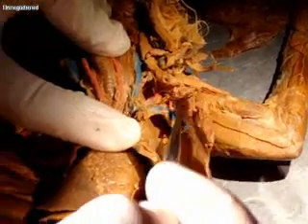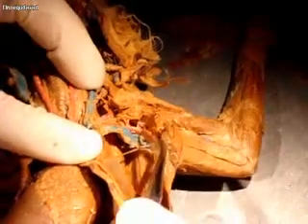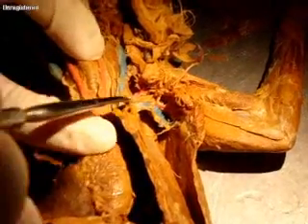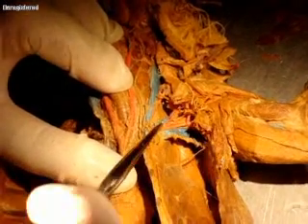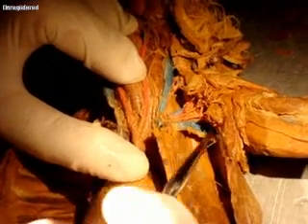That's going to continue into the arm as the subclavian. Once it gets into the axillary area it's called axillary, and then in the arm it's going to be called brachial. You can also see coming off here — this one is the subscapular. So subclavian is here and subscapular is here. Those are the veins on this side.